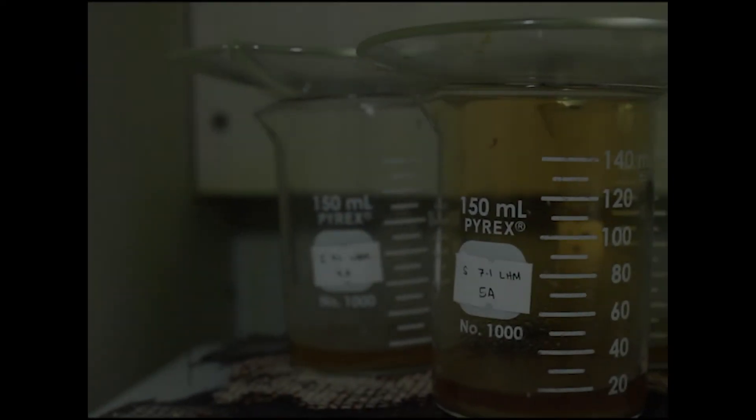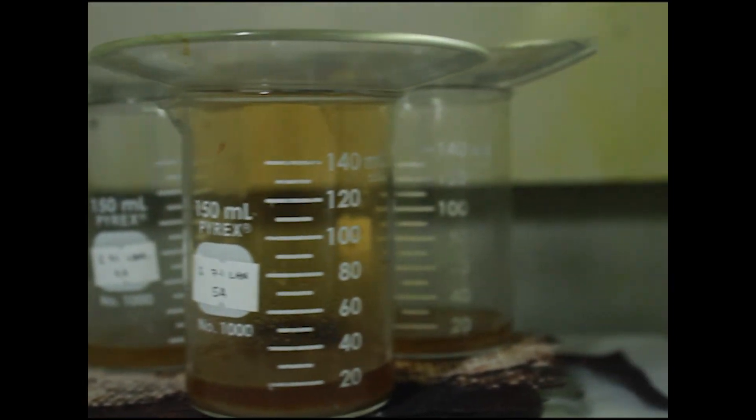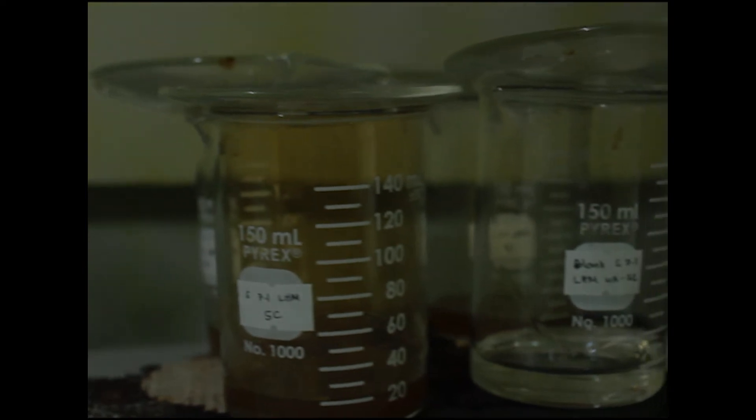When the samples are still releasing brown fumes, it means that the sediments are not yet fully digested. So I add another volume of concentrated nitric acid to it and heat it again.